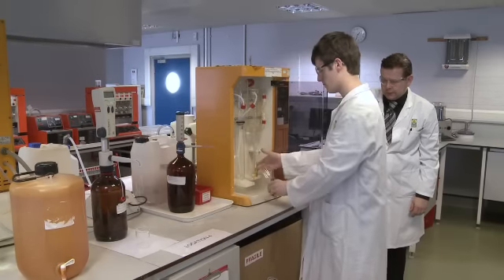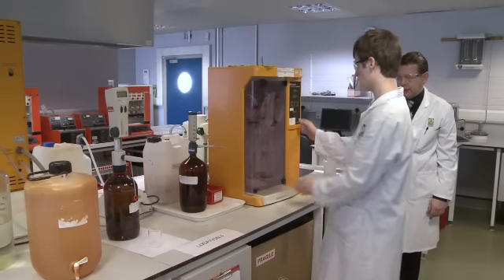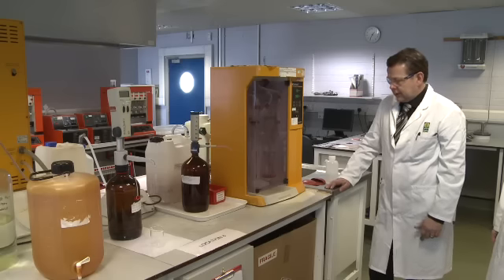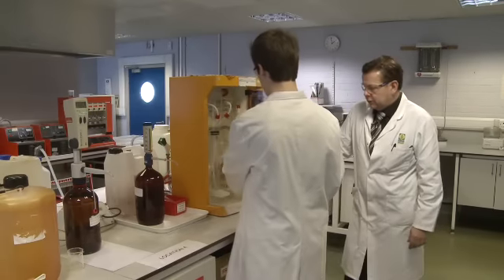The boric acid is placed in the unit with the receiver tip, or the dispensing tip, below the level of the boric acid due to the volatility of ammonia. As the ammonia salts are distilled across, the red boric acid solution, which has an indicator contained within, gradually changes colour, turning green, indicating the ammonia salts are coming across. The green solution now contains all the ammonium salts distilled over during the steam distillation process.